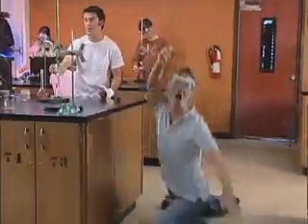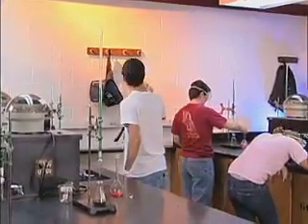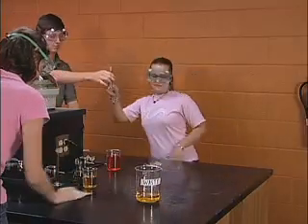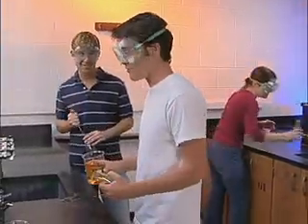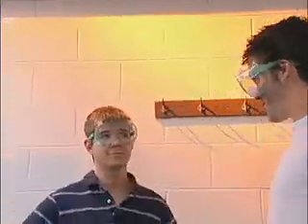Additional rule number 1. Book bags, purses, and backpacks should be off the floor and on the hooks provided. Additional rule number 3. Remember to always read all labels and dispose of waste in the appropriate containers. That was a terrible day, but I remember a particular day that got really bad.